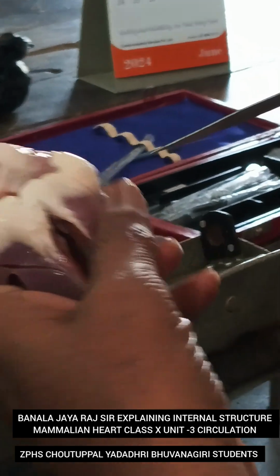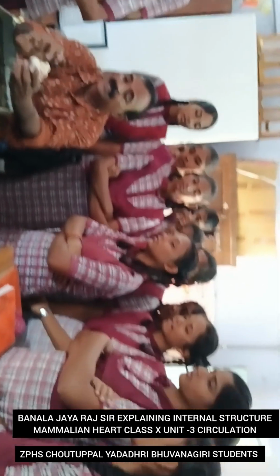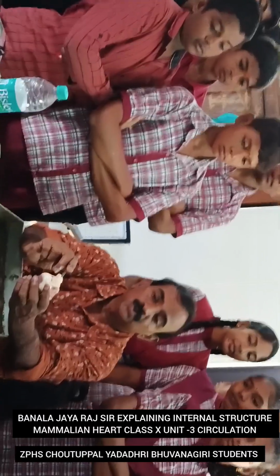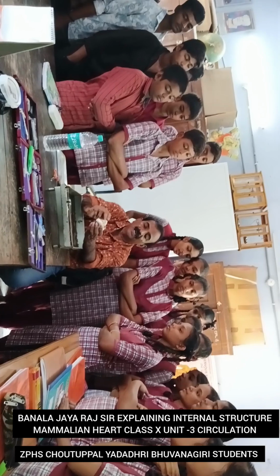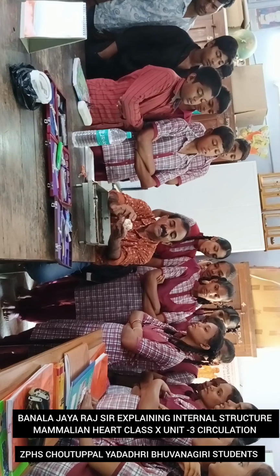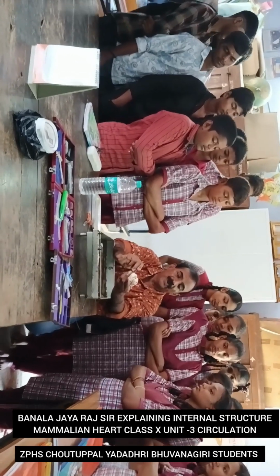Okay, you come this side, slowly, and you focus. This is what? Systemic aorta. Very good, Prem. And these two blood vessels are called the pulmonary artery, and this is called the superior vena cava. And how many chambers are there in the heart? Four. Upper chambers are called auricles and lower chambers are called ventricles. And this is the left auricle. This is the right auricle. This is the right ventricle. This is the left ventricle. The left ventricle muscle is thick when compared to the right ventricular muscle.